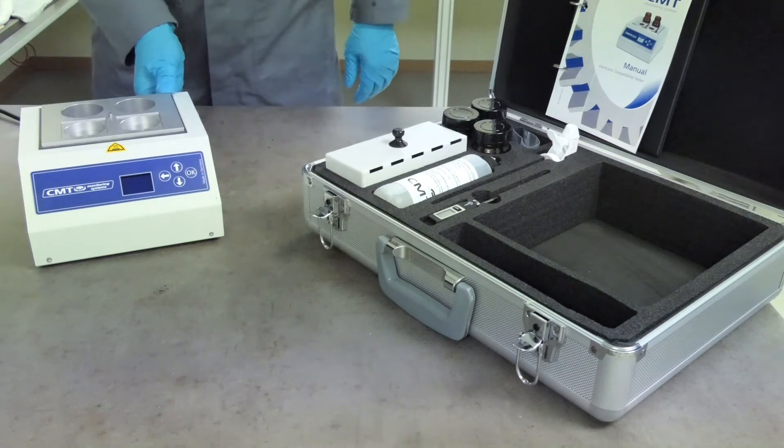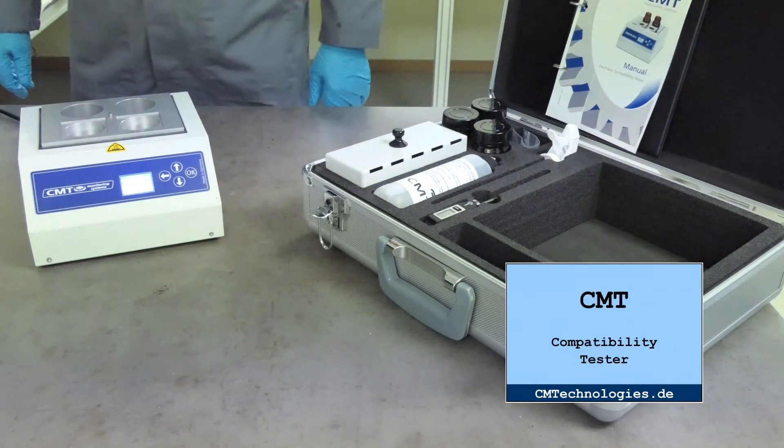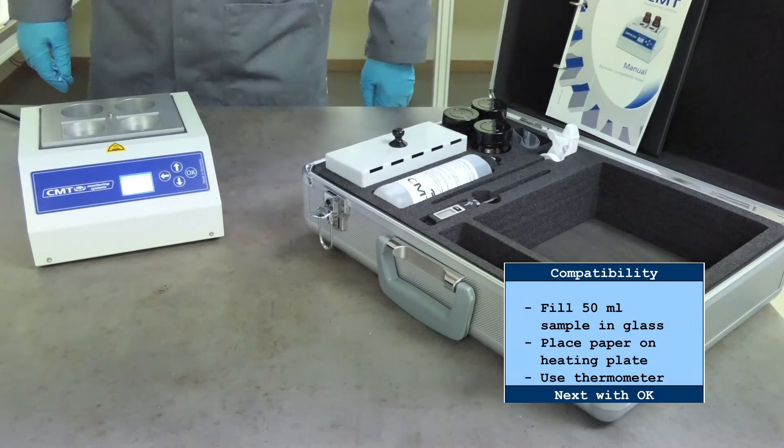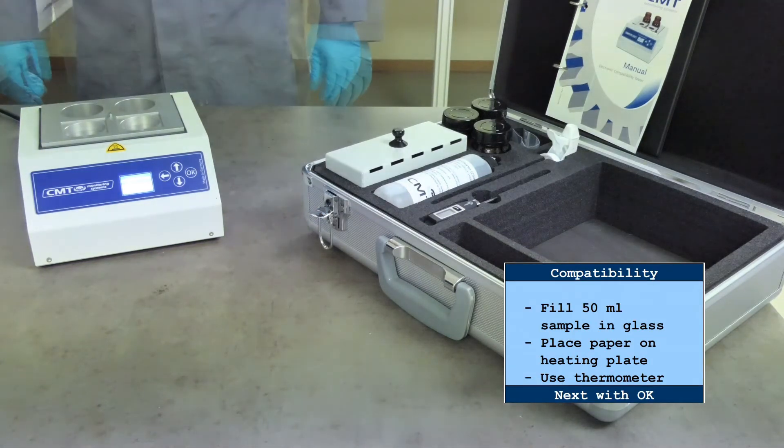Switch the device on and choose compatibility from the main menu. This is regardless whether you want to do a stability or compatibility test.